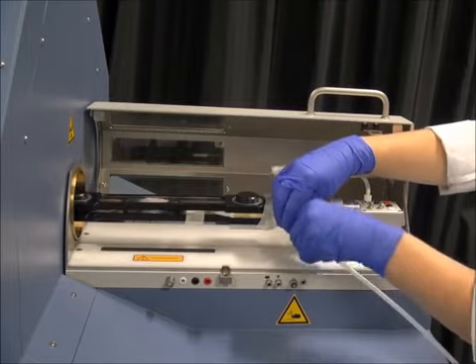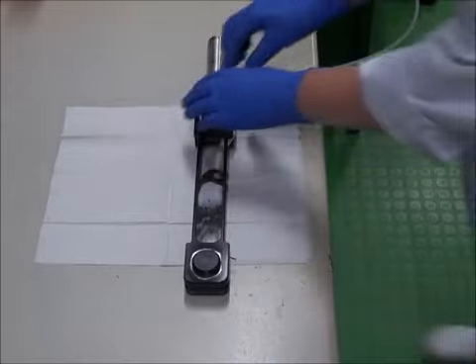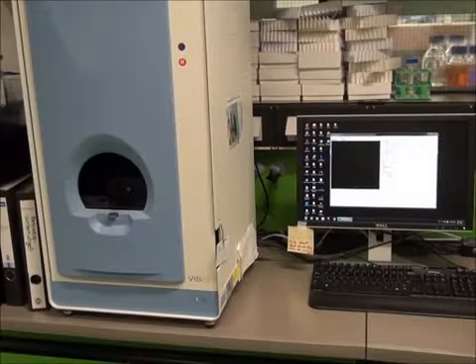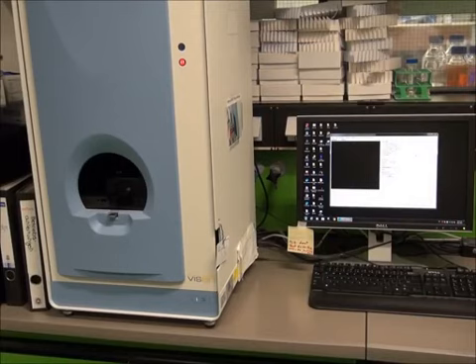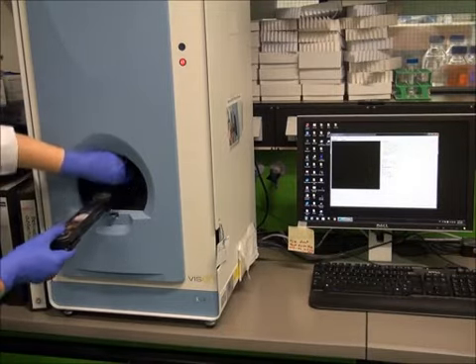The holder is carefully removed from the mousebed and the anesthetic tube is pulled out. This is necessary because the anesthetization in the FMT does not depend on this small tube. Instead, a small chamber inside the FMT is flooded with anesthetic gas. Now the mouse bed with the mouse is brought over to the FMT and inserted.